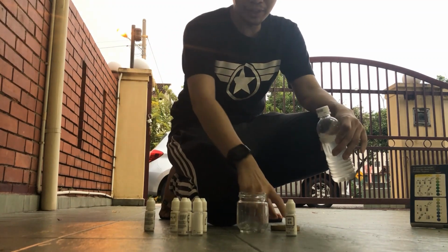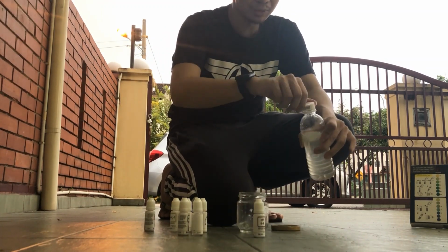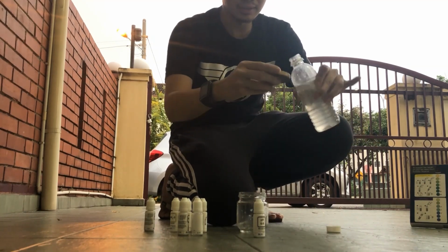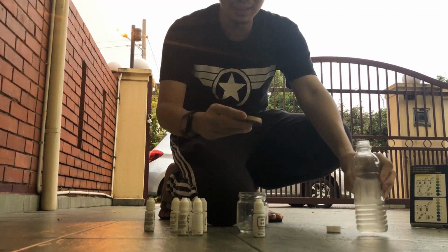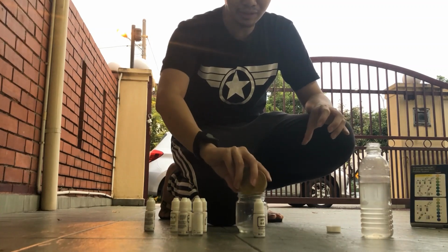Right, so now I'm going to carry out the pH test. The pH one could be more obvious because every water has its own pH. Let's see whether this water is extremely acidic or extremely alkaline. Water that is too acidic or too alkaline is definitely not suitable for you to drink or for any household activities.